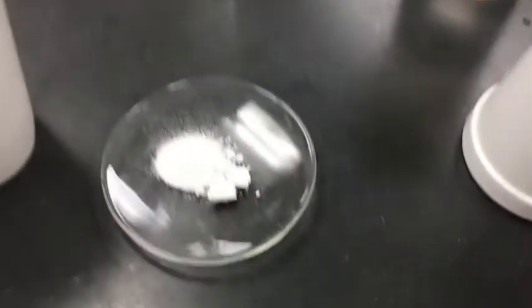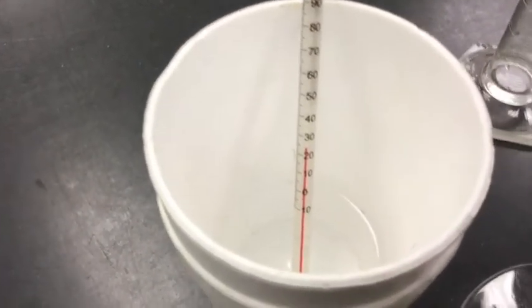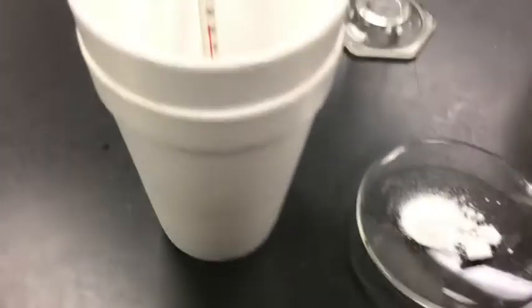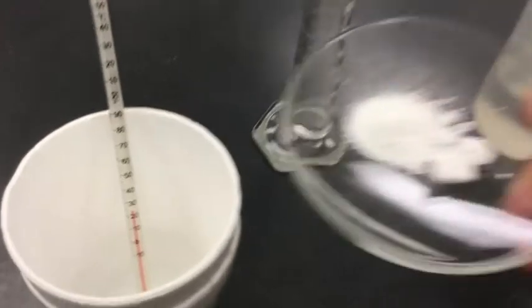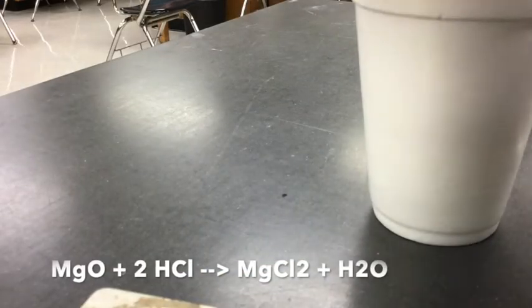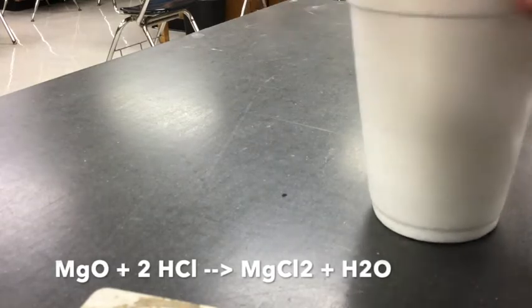So we started here at 23 degrees Celsius, and I have 1 gram of magnesium oxide to put into 100 milliliters of the hydrochloric acid, which we are kind of assuming is water, but it's not quite exactly. So here I go. I'm going to go ahead and put in my magnesium oxide, and all that magnesium oxide goes in. Sorry, again, it's real tough to do these things by yourself. So that goes in, and we give that a stir, stir, stir.